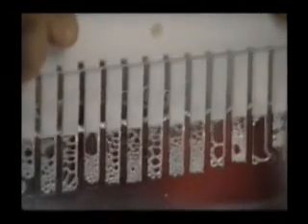A polyacrylamide gel is cast between two glass plates separated by spacers. After the polyacrylamide solution is poured, a comb is inserted into the top of the sandwiched solution. When the gel has set and the comb is removed, it will leave a neat line of wells into which different samples can be applied.